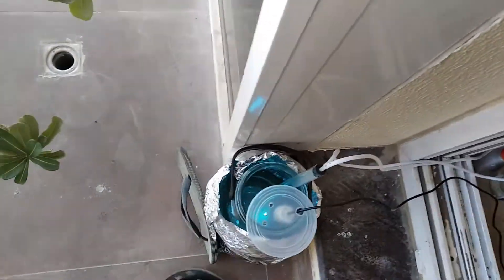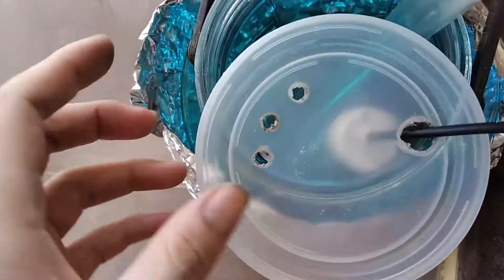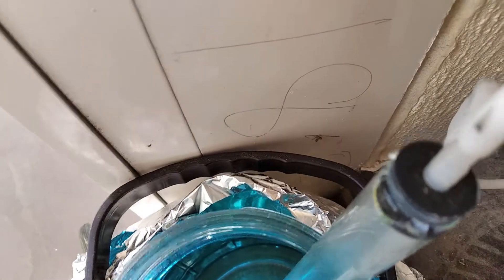Over there are bubblers, and there's the actual thing. It contains a UV-C lamp. And since the chlorine is wet, it does not explode. So what we have here is a quartz tube.